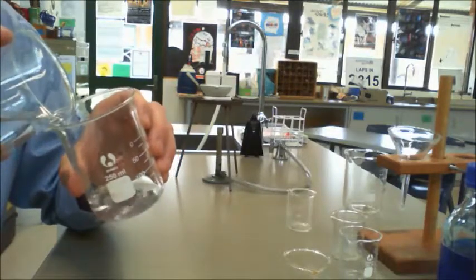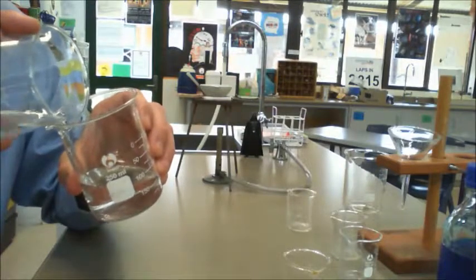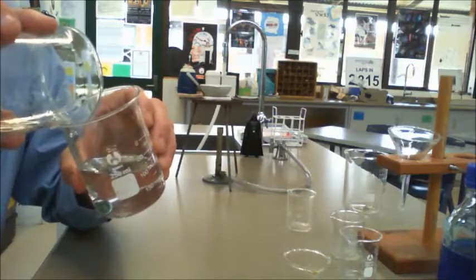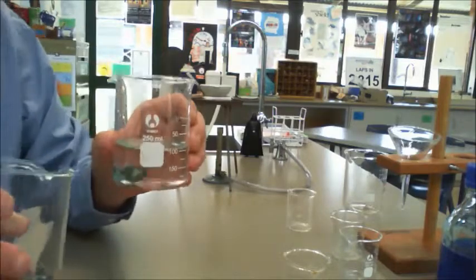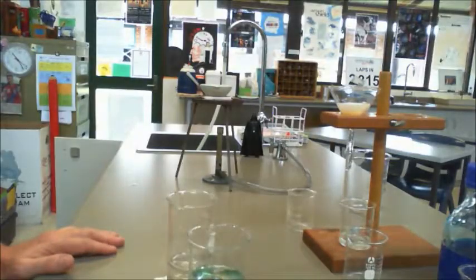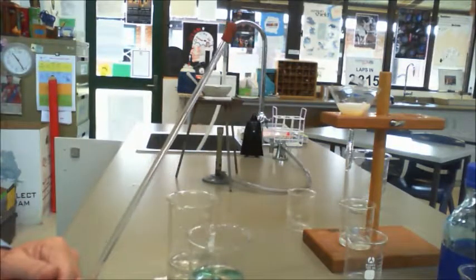Now, that's really easy when you've got marbles in the bottom, but more difficult when your insoluble substance is a little bit smaller. But even in saying that, one fell in, so that can create a bit of a drama. A better way than pouring it, of course, is to use a stirring rod.